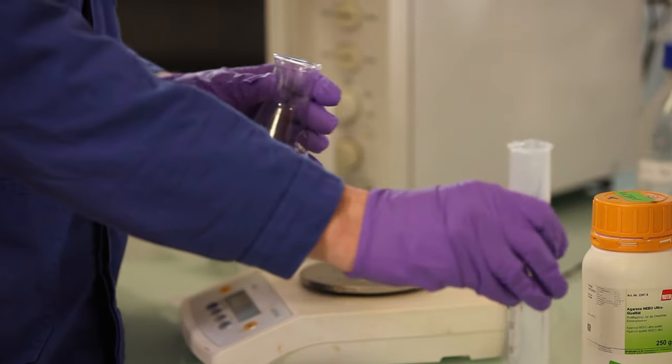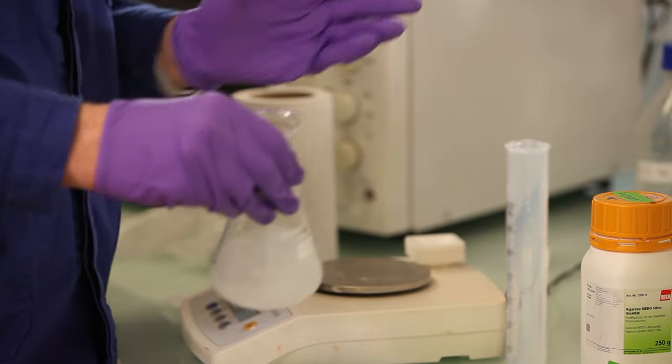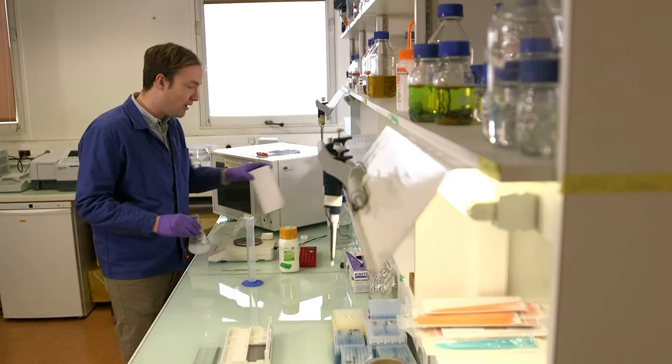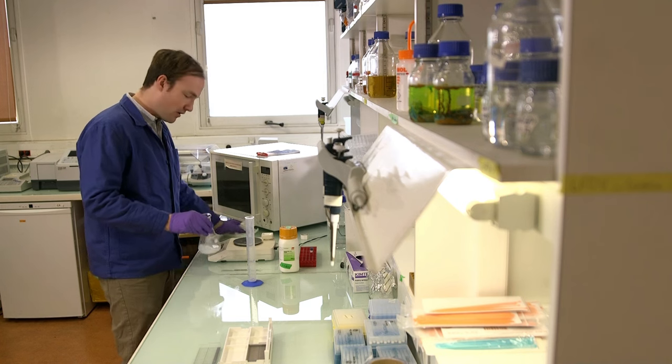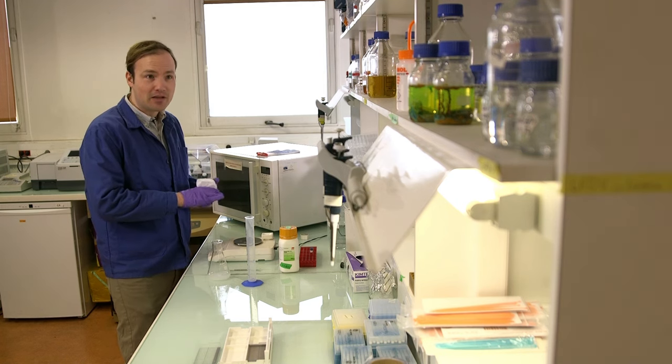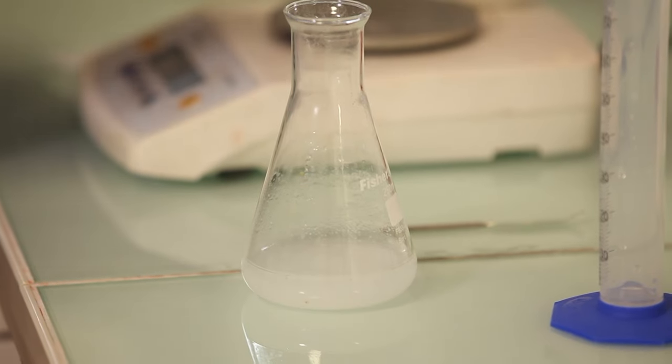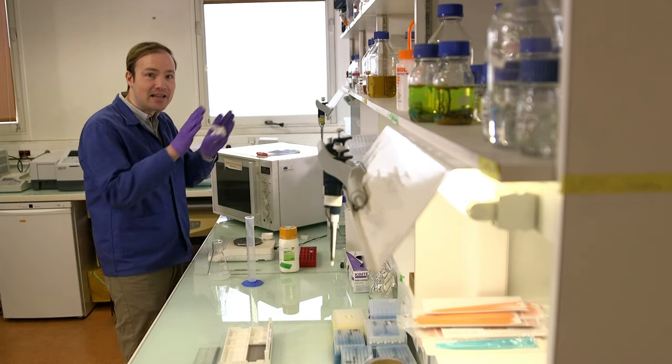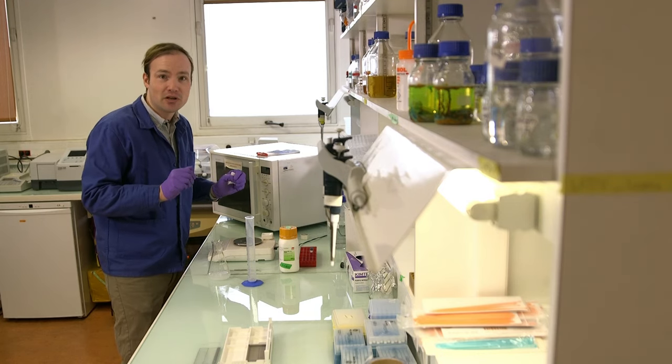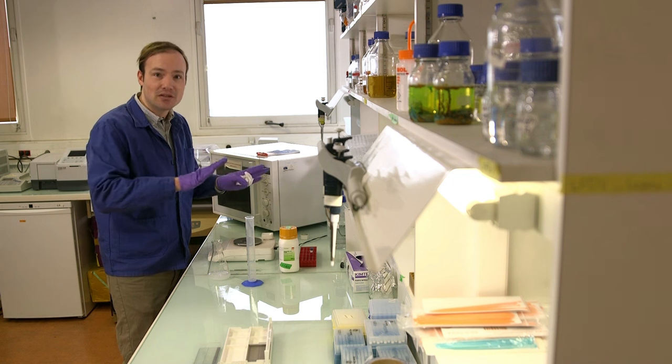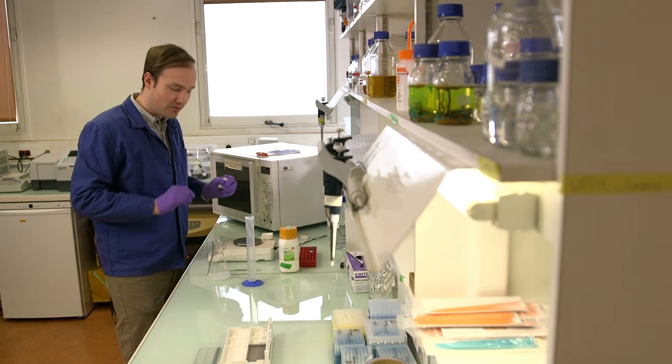You may find TAE in your lab, so that's another common buffer. It works just as well. It does all the same things, but importantly, you can't mix the two buffers. So if you've got TAE and TBE, or maybe you're using another buffer, you've got to be consistent through the whole protocol. Otherwise things won't work.